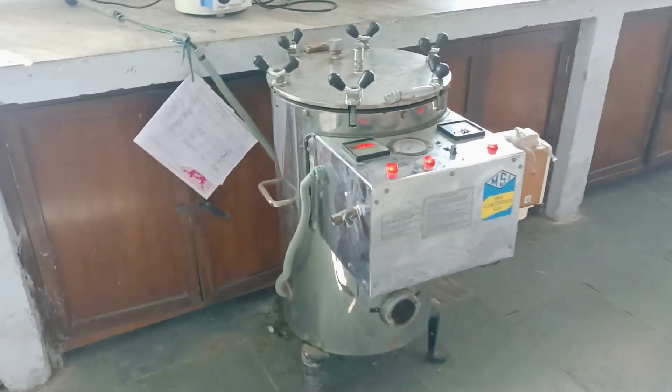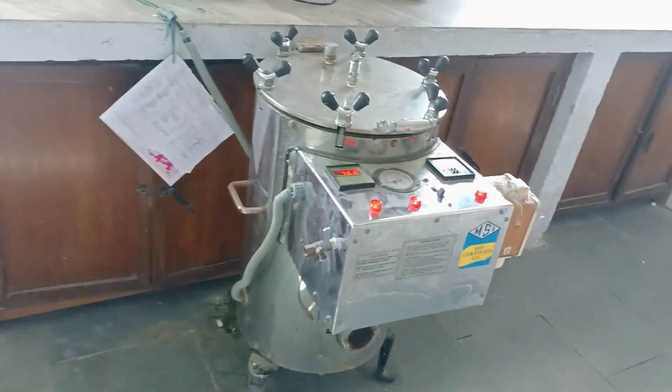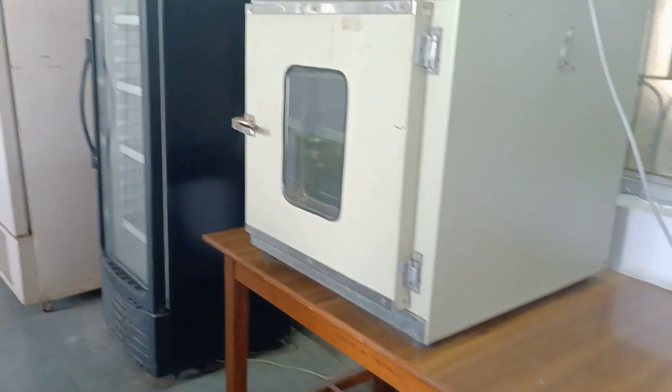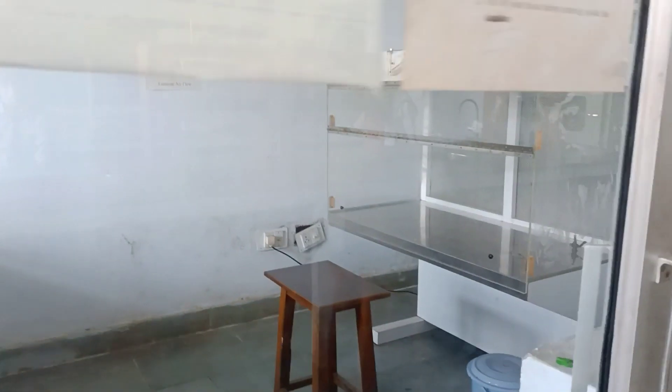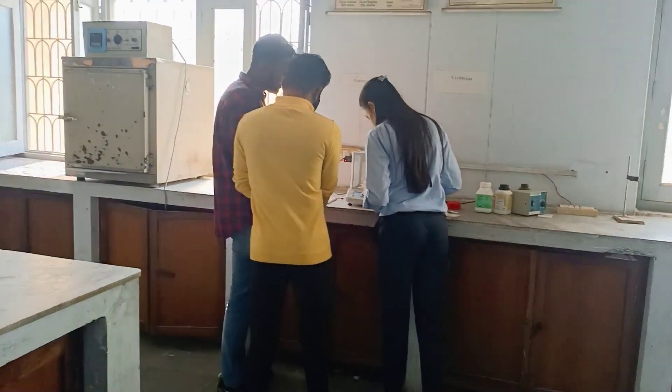This is the autoclave — generally we use it for our glassware, media, whatever we want to sterilize. This is an incubator. This is a fridge. This is a BOD incubator. This is a LAF chamber — you can see we always make plates here, so we use the LAF, which is also called the aseptic chamber. Okay, let's go to the other lab.